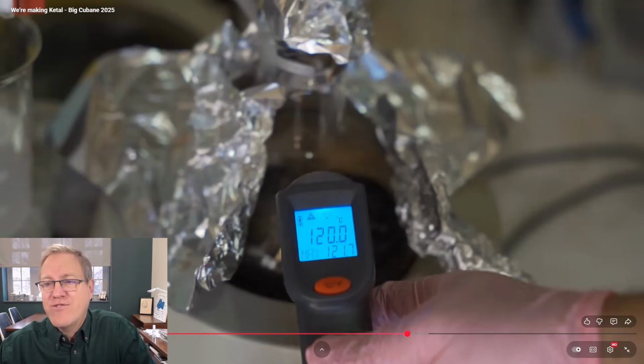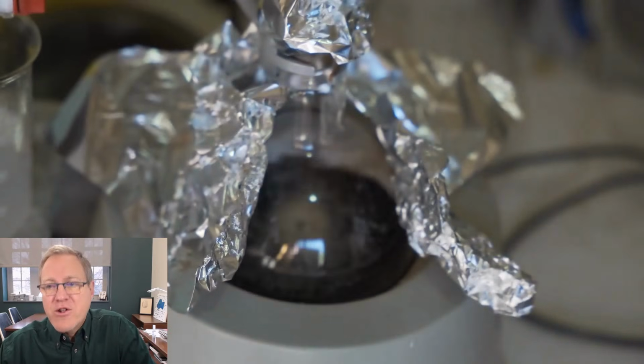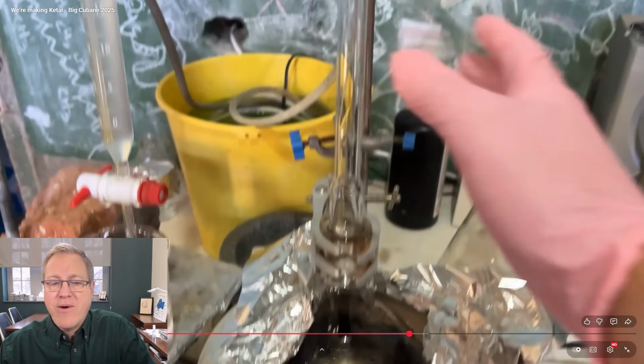Okay, this still has some music going. He's monitoring the temperature. Okay, now I think we can listen.